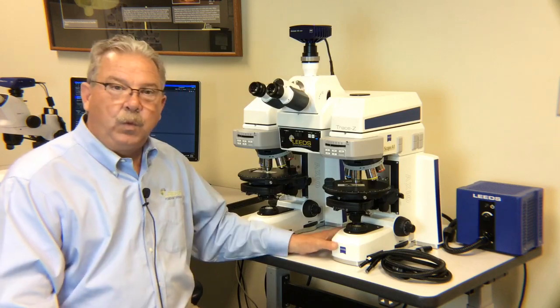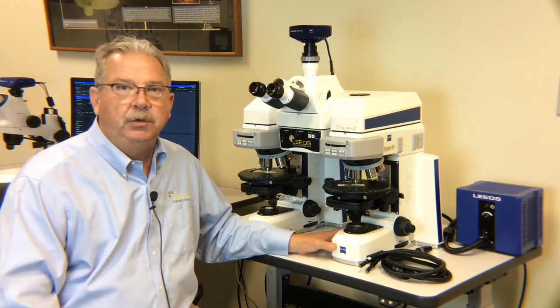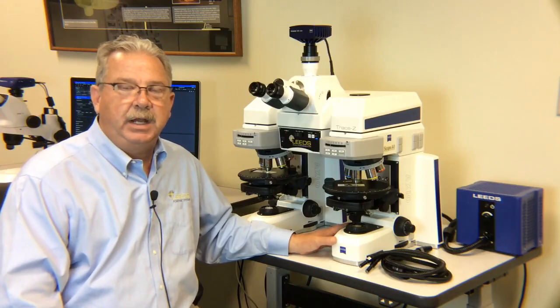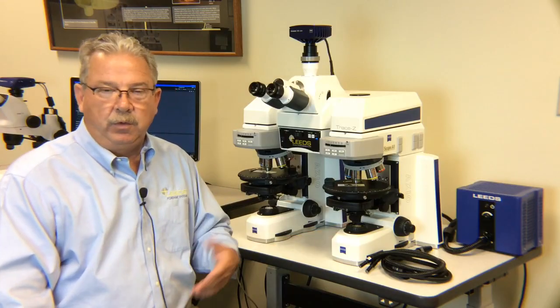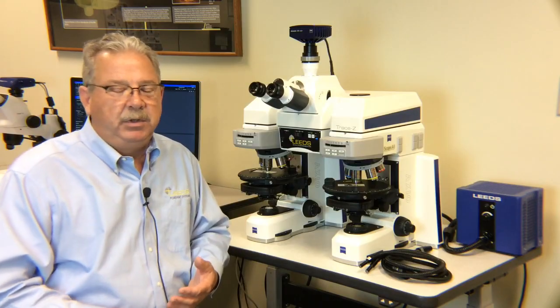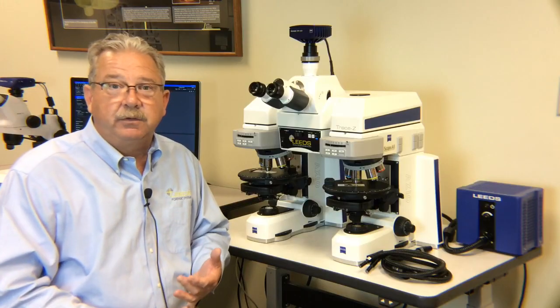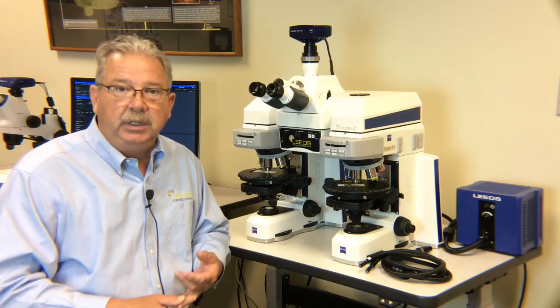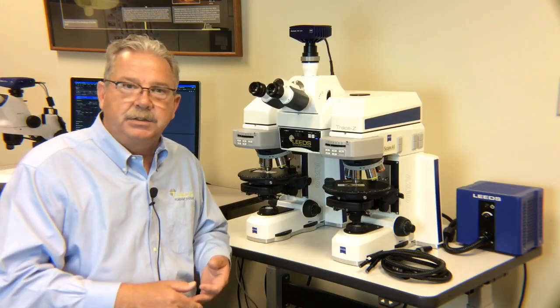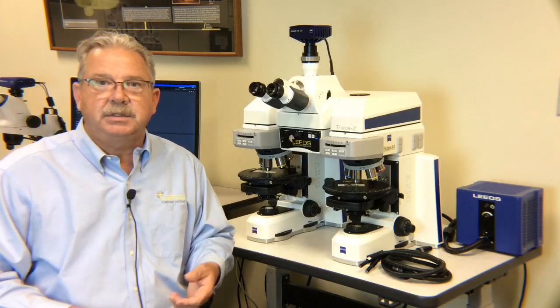First of all, we sell and design the microscope similar to how you would a single freestanding microscope. We review with the customer the techniques that they want to perform. It may be polarized light to compare artificial fibers. It could be phase contrast, regular transmitted light, bright field. It could be reflected light fluorescence.